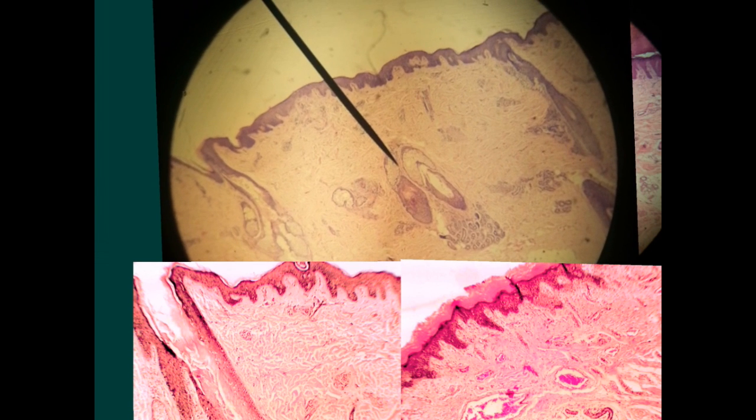Here we have the thin skin. In case of the thin skin, you will notice that the keratin is very thin, and we will search the whole epithelium. You will see this opening of the hair follicle. Sometimes you cannot see these openings, and you will see the hair follicles deep here in the dermis, and most probably they have a yellow coloration inside of the follicle, denoting the pigmented part of the hair itself. And also we have here sebaceous glands. Here we have sebaceous glands related to the hair follicle.